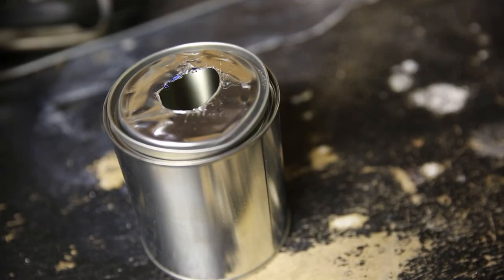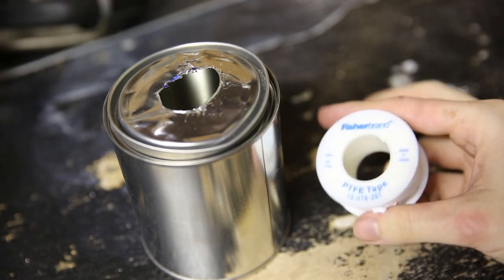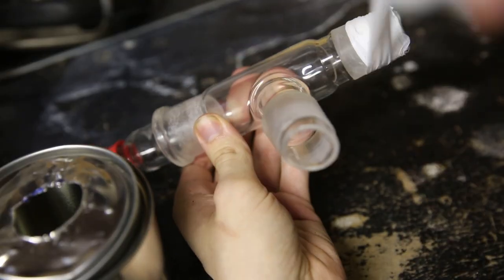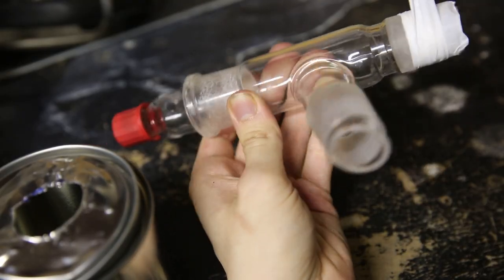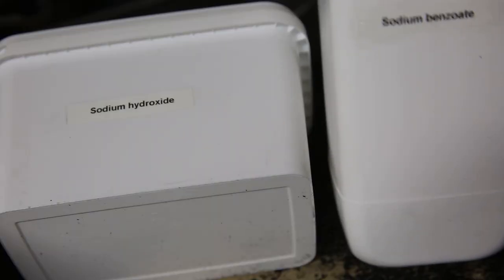It doesn't have to be perfect since I'm going to wrap the adapter with teflon tape and I can always use more if it is too big. So that is all for the reaction vessel.